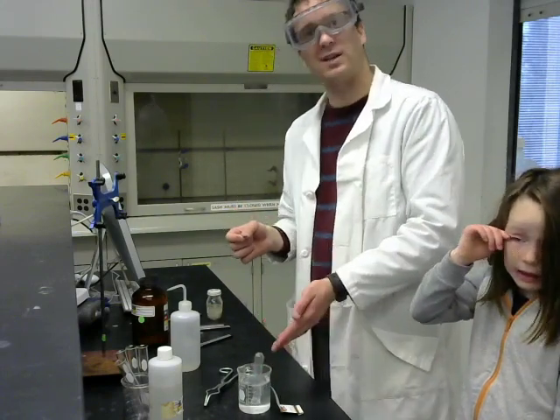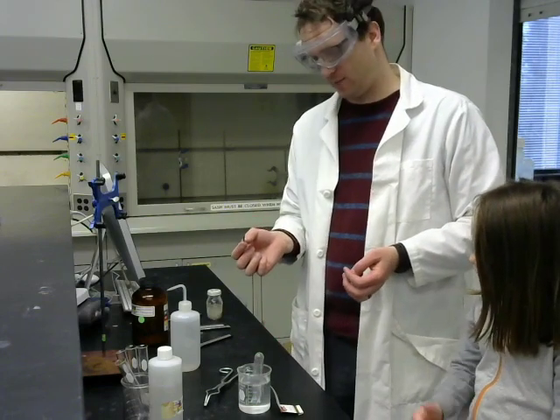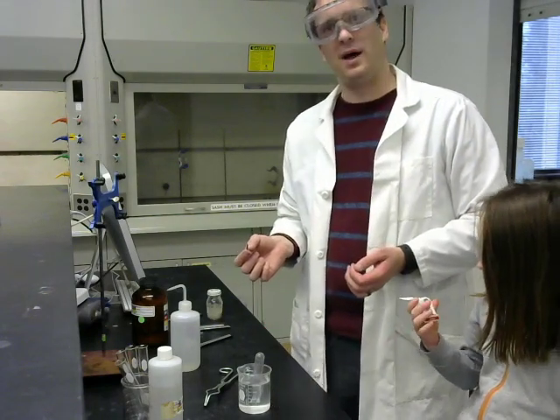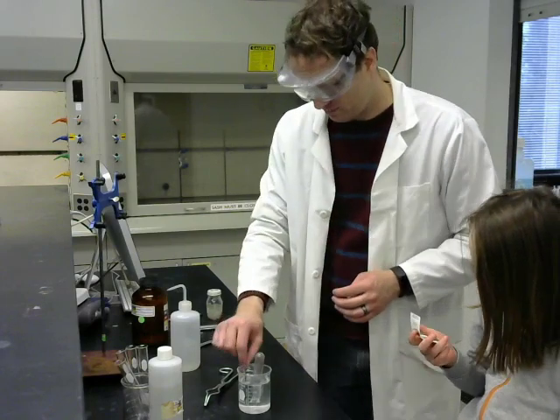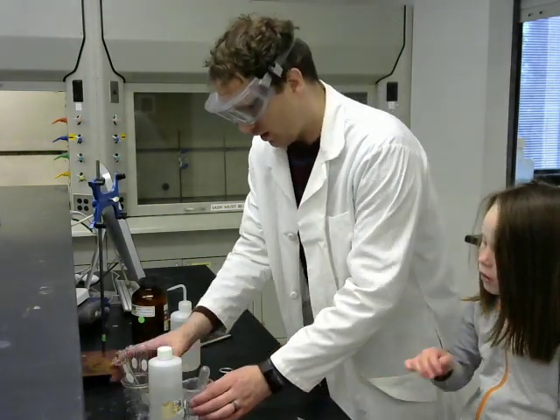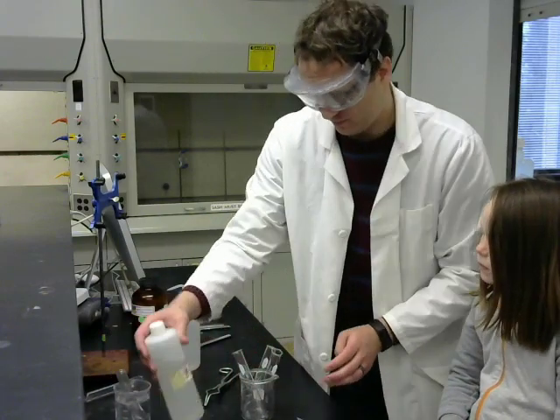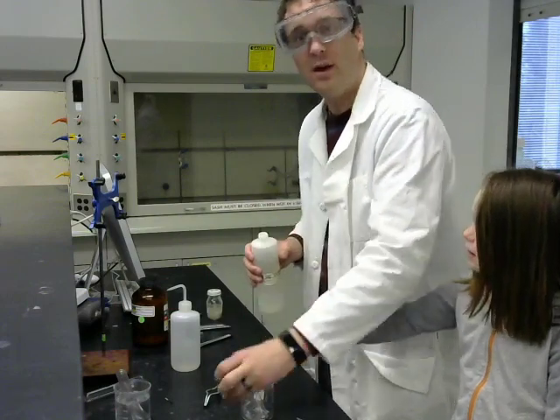Now we won't check the pH of this solution because it was 1 molar hydrochloric acid. Remember, it's less acidic now than it started with, but it's still overall acidic, so it wouldn't turn the litmus paper blue at all. Now we're going to fill 3 test tubes with 3 molar hydrochloric acid, which I just have a sample of. What's that, team?